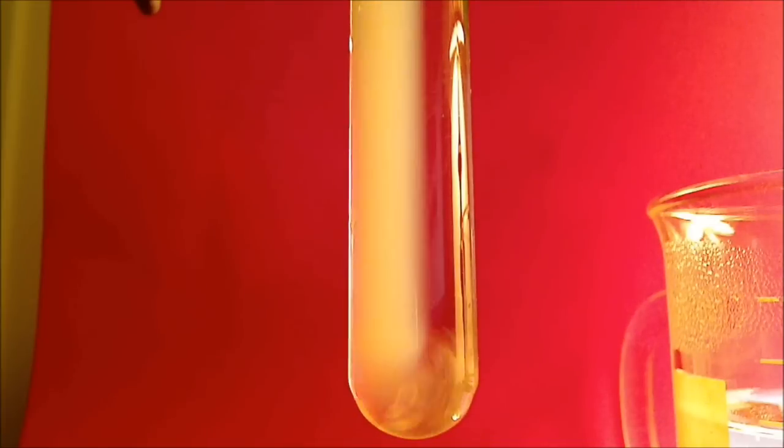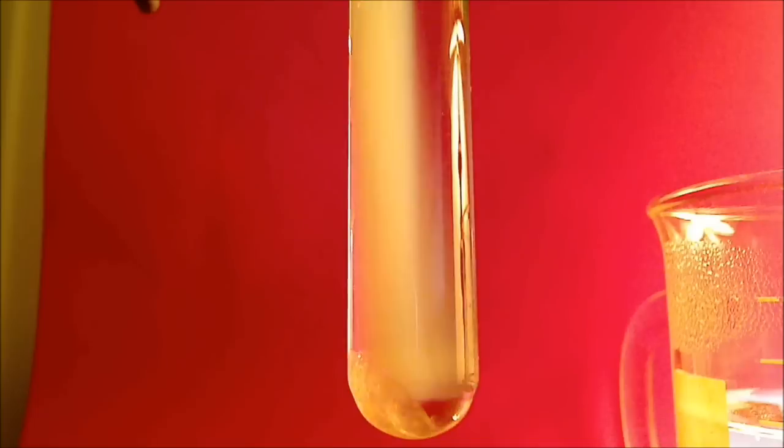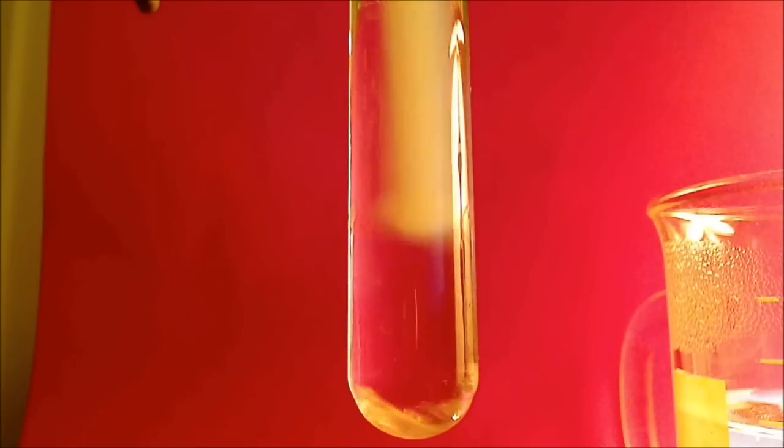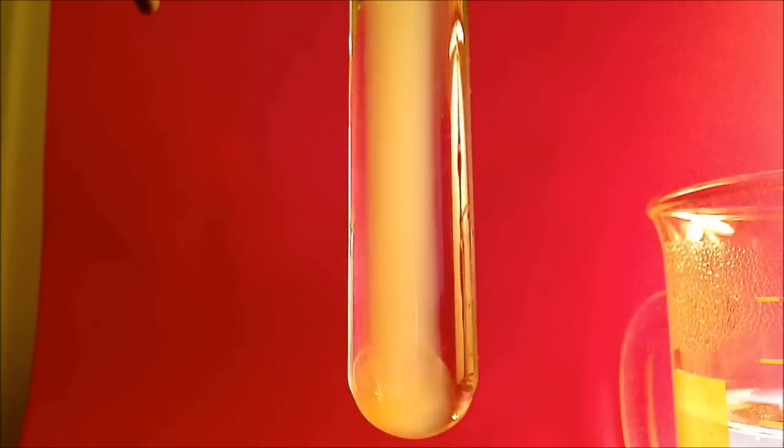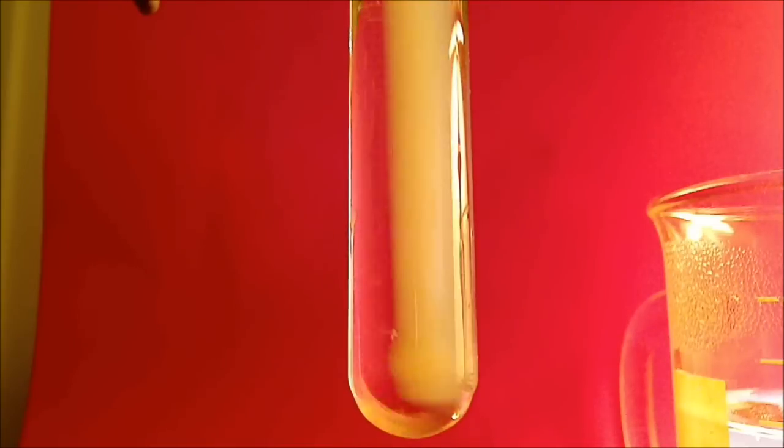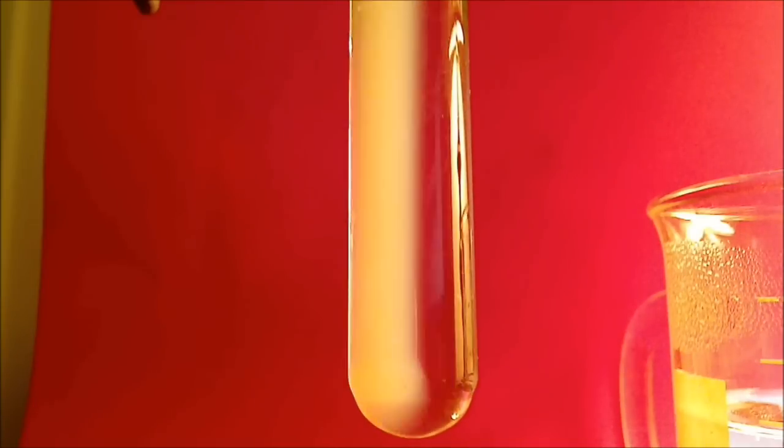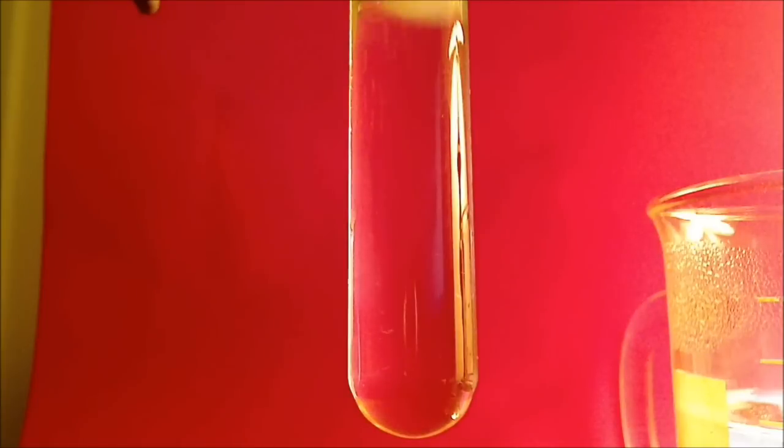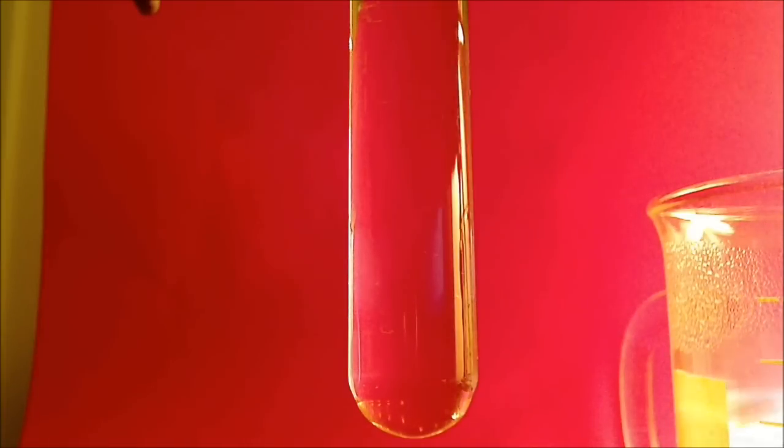Slowly dissolving, it will completely dissolve in a few moments. Looking at it live rather than on the video, it's more dramatic. You can see the striations as the solid dissolves into the liquid to produce a paradichlorobenzene solution in acetone. Now it's completely dissolved. So, that's an example of dissolving, which is different than melting. And I think this example makes that clear.